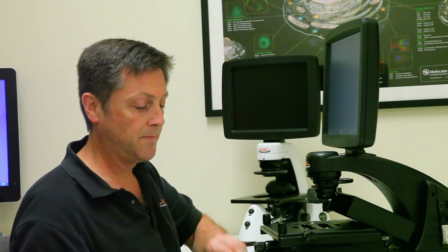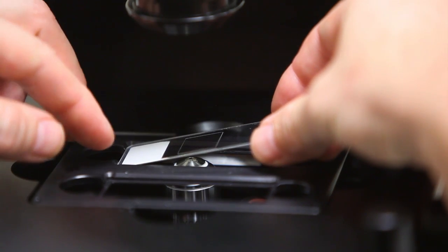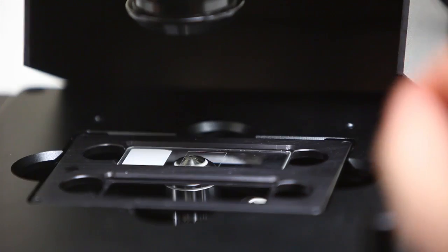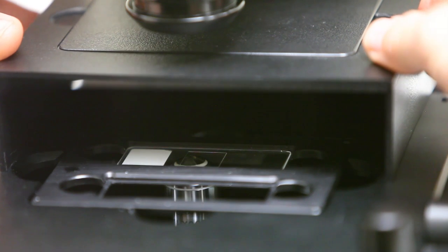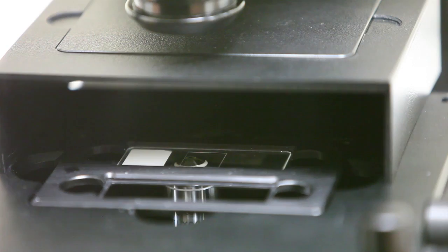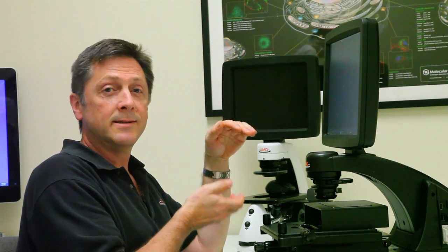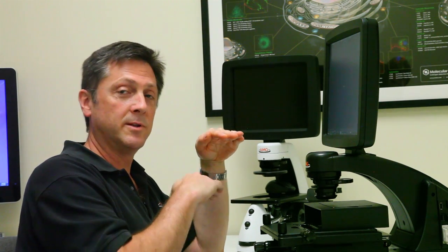Now I'm going to take my sample and put it back where it started from here. I had it pushed in here so that it was kind of up in the corner. So we're going to be at higher magnification, obviously, when we switch this back. And for the EVOS, I can just put this little cover on it here to kind of help keep out some ambient light while I do my work. And now I'm ready to find my sample again with the 100x oiled objective. So right now the objective is in place, but it actually isn't touching the cover slip. I've lowered that objective so that there's a gap there, even with the oil on it.